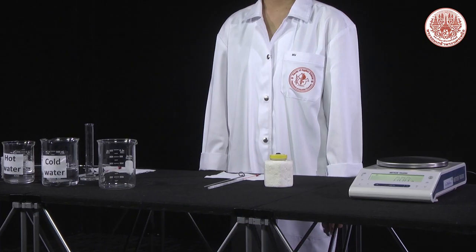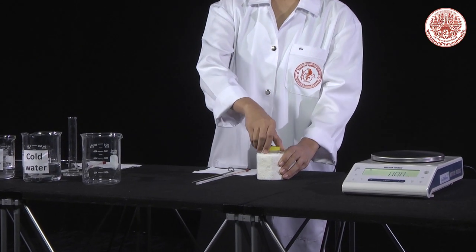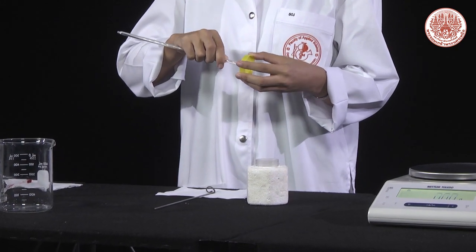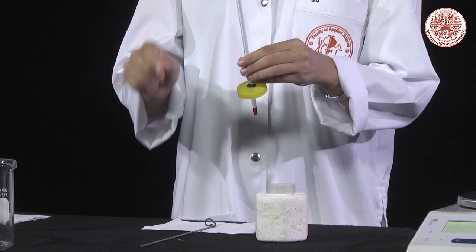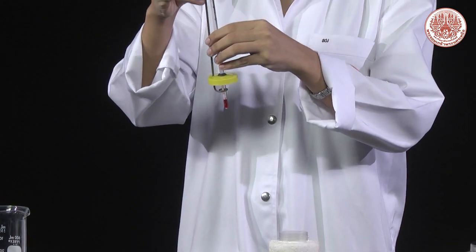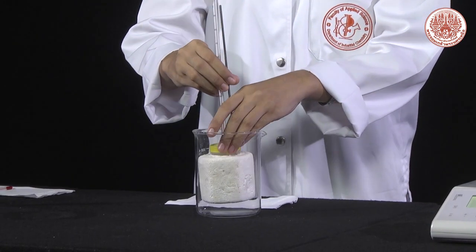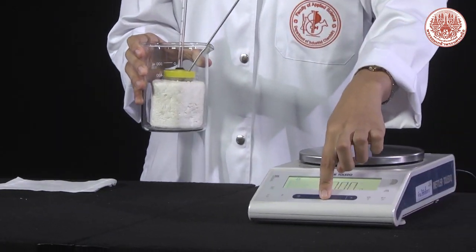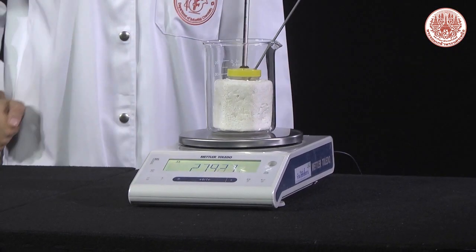For the experimental procedure, first install the calorimeter set by opening the calorimeter cap, then insert the thermometer and stirring rod. Close the cap, then place the calorimeter in a 400 ml beaker. Weigh the calorimeter and record.